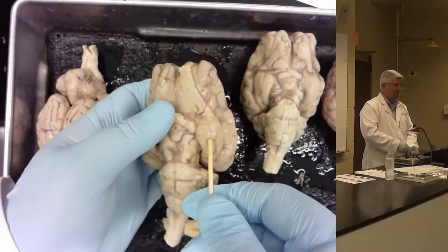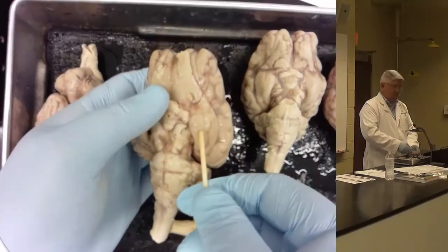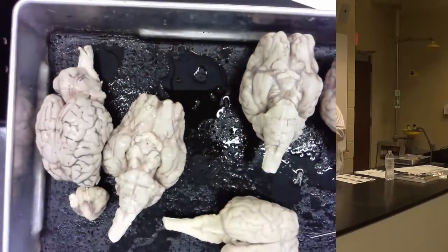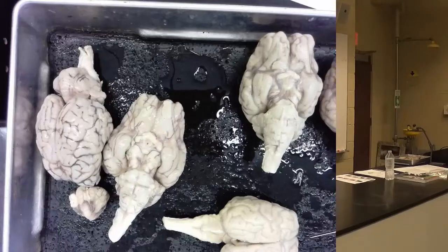So this is actually the hippocampus. We call it the hippocampal gyrus because it's on the surface of the sheep brain. But in the human brain, if I can hold this like that, this is temporal lobe. Where it's cut there is the lateral sulcus, that big thing separating temporal from parietal and frontal. Big temporal lobe, inside the temporal lobe is the hippocampus. You can't see it in the human brain. The temporal lobe wraps around it because we have big temporal lobes. What do you think the temporal lobe's function is? Anyone watch my lecture yet?